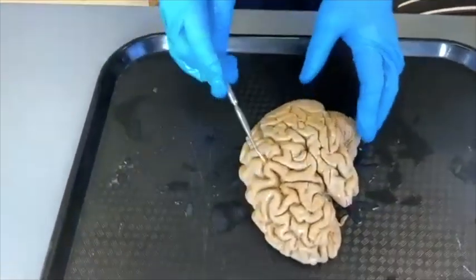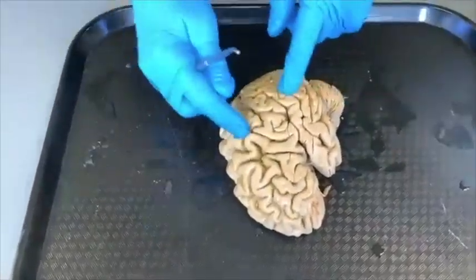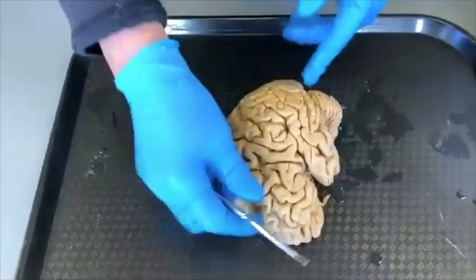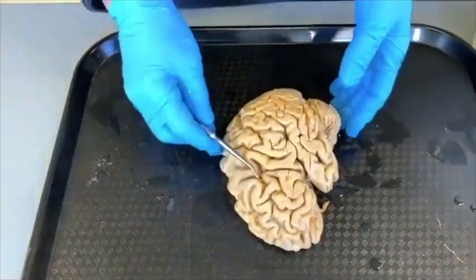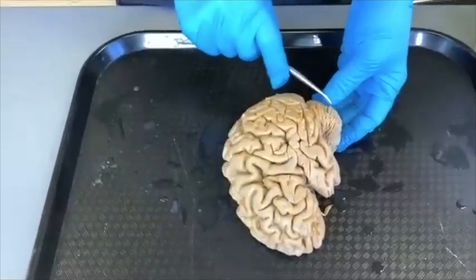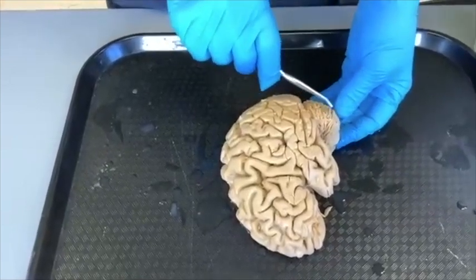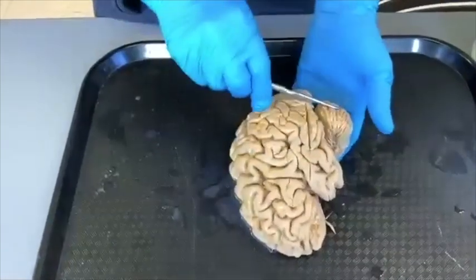As we look at the brain from the side, all we see is telencephalon — this is all cortex. The telencephalon has sulci and gyri: sulci are the valleys and gyri are the hills, giving it more surface area because cortex is a surface structure. And this back portion is the cortex of the cerebellum, which has its own folds called folia.